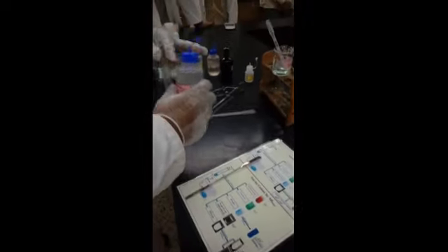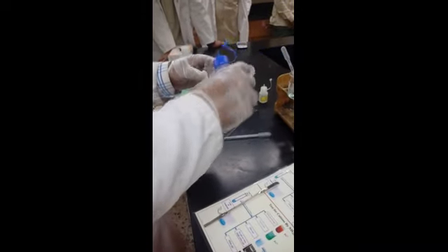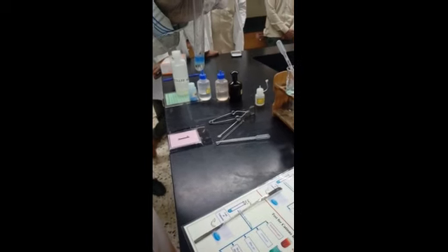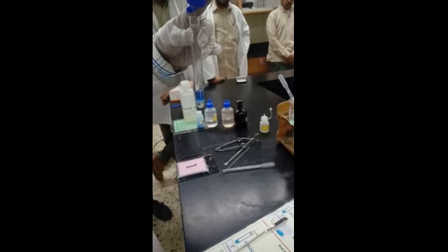So the same test tube you are with still. So you are going to add excess, because it says continue. Excess means how much? Around 20-25 drops. Okay, let's start. 1, 2, 3, 4, 5, 6, 7, 8, 9, 10, 11, 12, 23, 24, 26. Okay, around 25 I did.